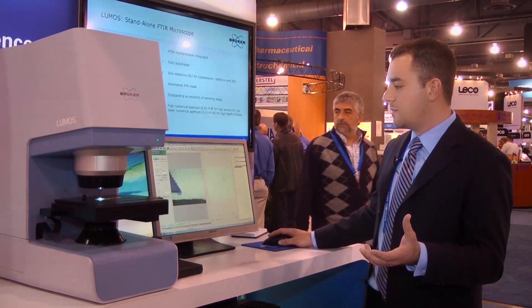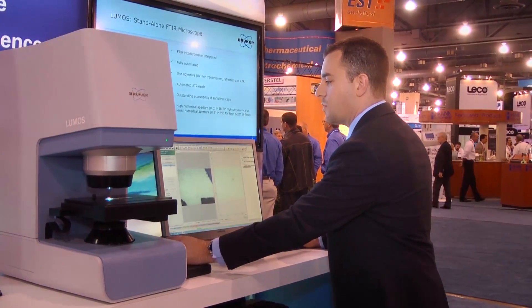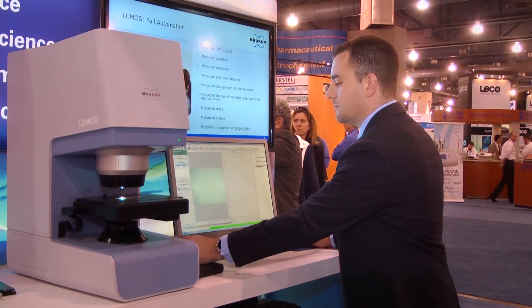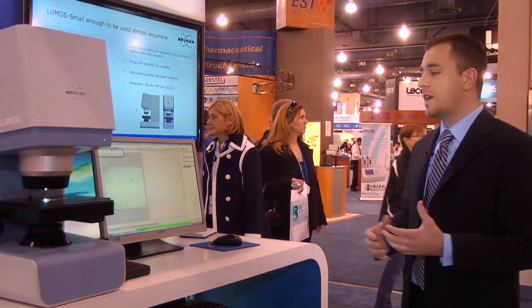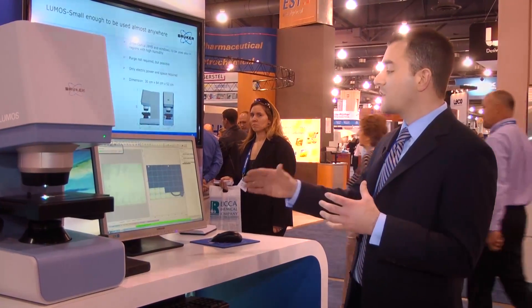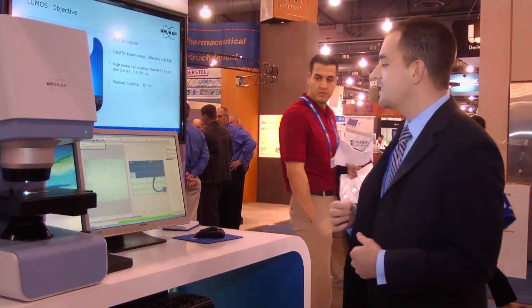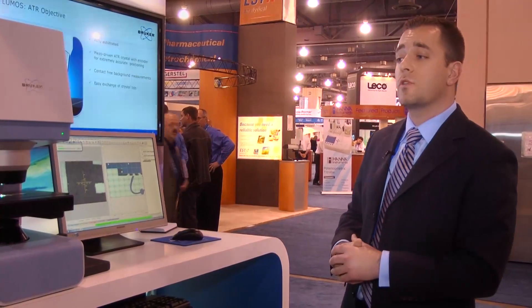By deactivating the zoom and building a larger image, I'm able to click on this, add border points, and then collect a larger image. This can be really useful for looking at different particles and different areas of analysis on the sample. This looks like a fiber probably from my jacket. You can see the stage automatically moves to all those individual positions, building us a nice large mosaic image.